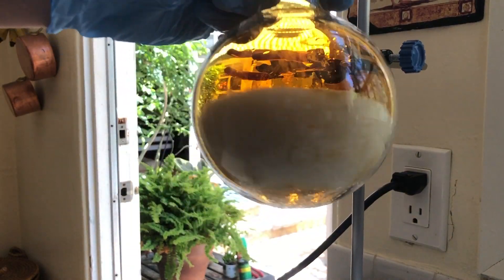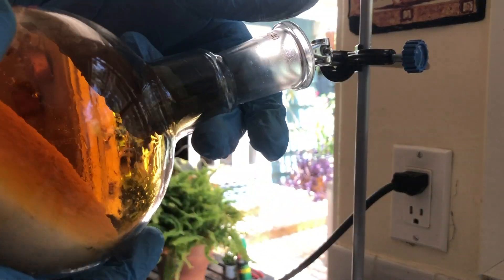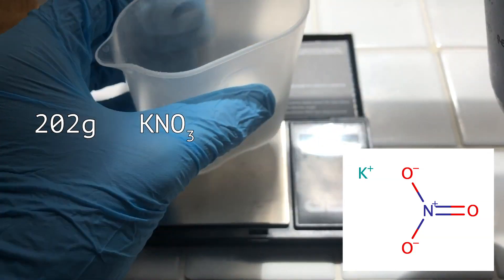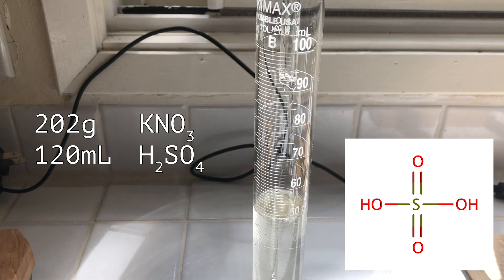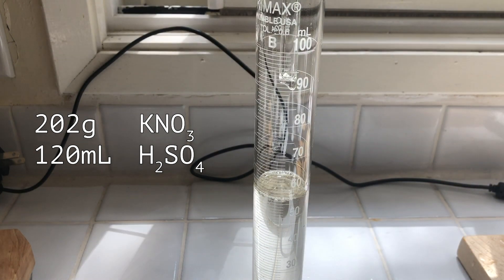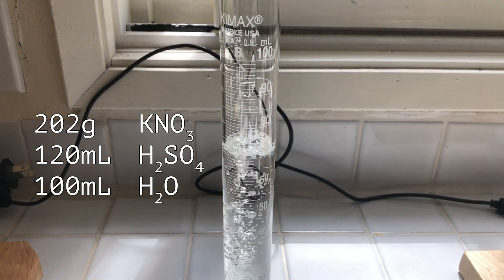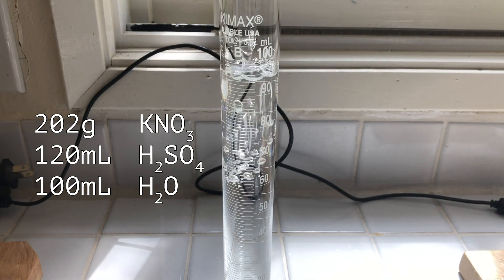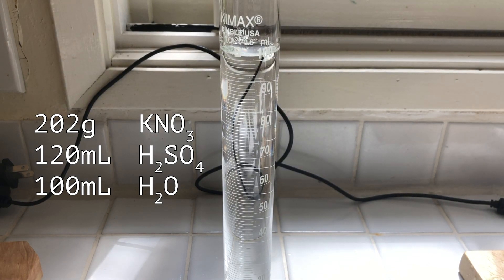Too much of the potassium sulfate crashing out early in the distillation could trap the gases that we're trying to distill, plus it would make it harder to clean up my flask. I'll be using two moles of each reactant, so 202 grams of potassium nitrate and about 120 milliliters of this drain cleaner sulfuric acid. I'm assuming that the sulfuric acid is at a concentration of about 92%. Because we'll be making azeotropic nitric acid, I'll have to add a little bit of water, as the 10 milliliters in the sulfuric acid won't be enough to dilute it to its proper concentration. Since I'll be redistilling later anyway, I'm adding 100 milliliters of water.